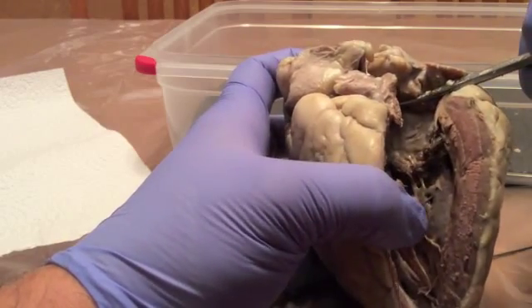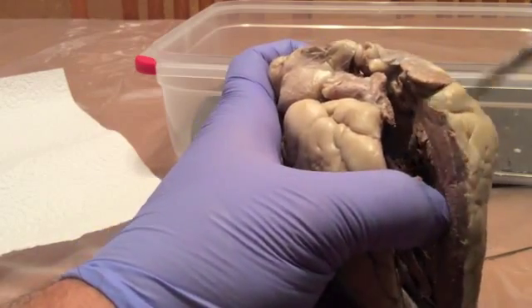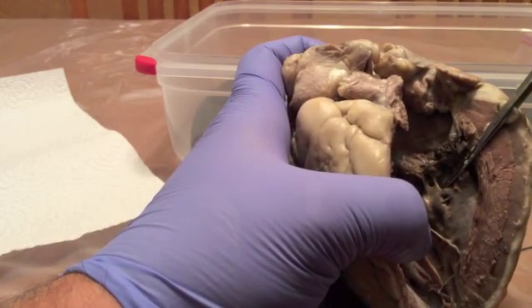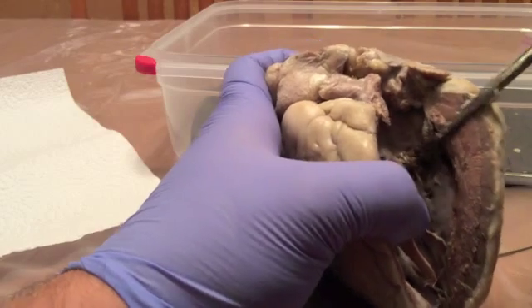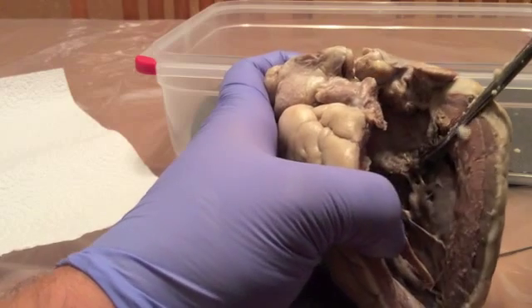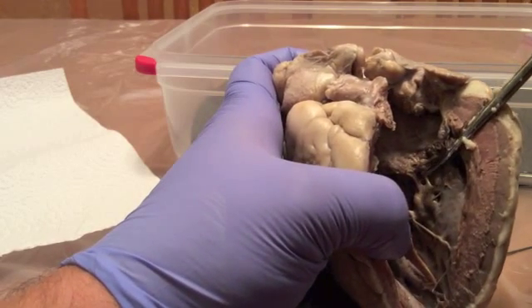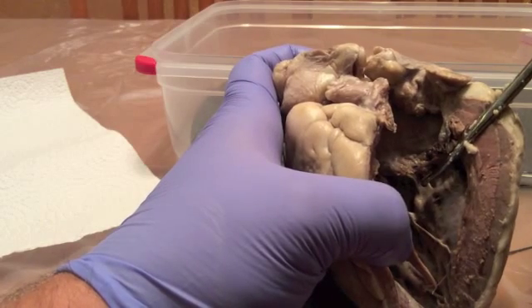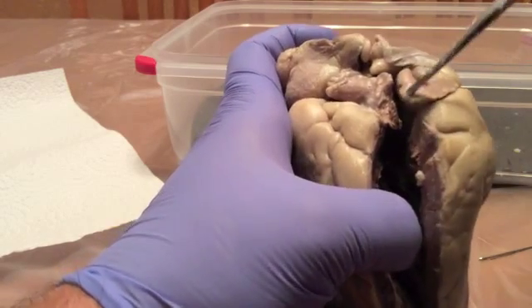Up on the leading out of the left ventricle, we're going to have the aortic valve, which is up here on the aorta. Keeps it from back pressuring back into the ventricle after it pumps out, kind of like a backflow system, so it doesn't seep back in and kind of mess up the whole system.